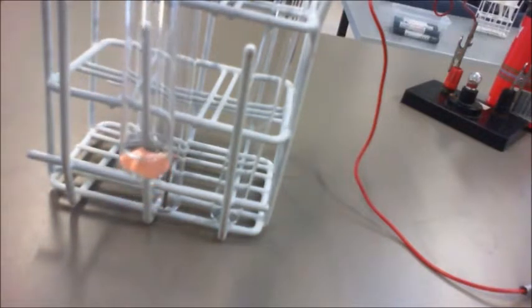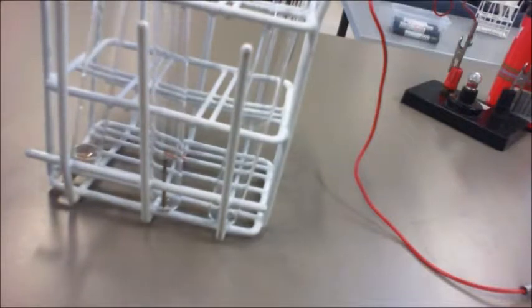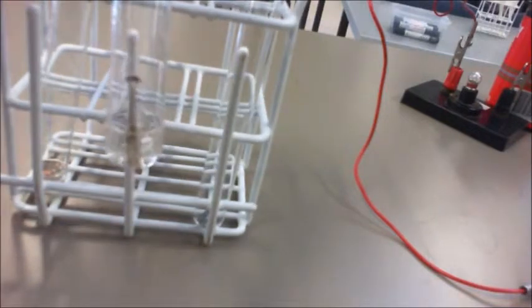Let's start with the copper first so we can see what happens there. We've placed it in, we give it a bit of a shake to speed the reaction up, and as you can see, not a lot is happening with the copper. It's basically sitting in the hydrochloric acid and nothing is happening. Let's then have a look at the iron. We've got another iron nail there in the bottom, and we need to put a little bit in with this because the nail is reasonably big. Okay, so you can see there, and it's not the clearest of cameras, but what you can see is that there's a little bit of a reaction there.